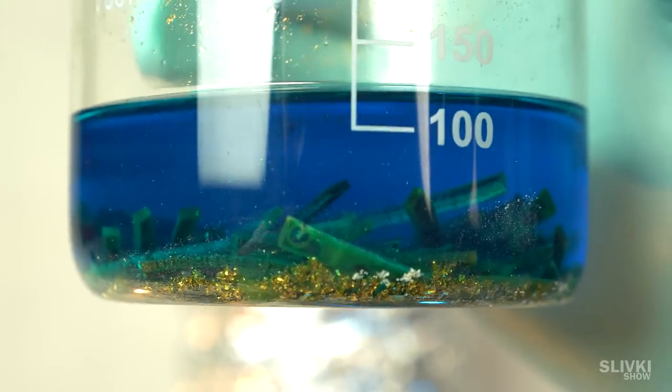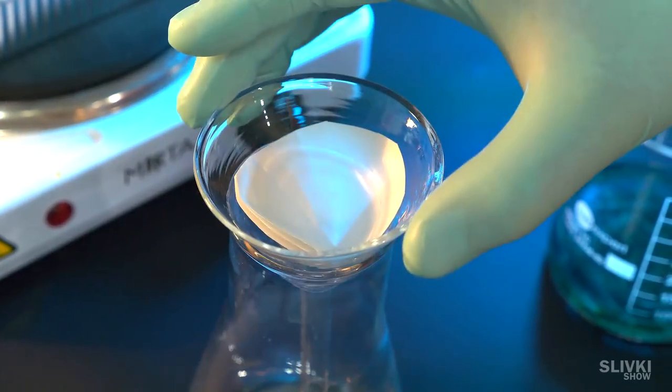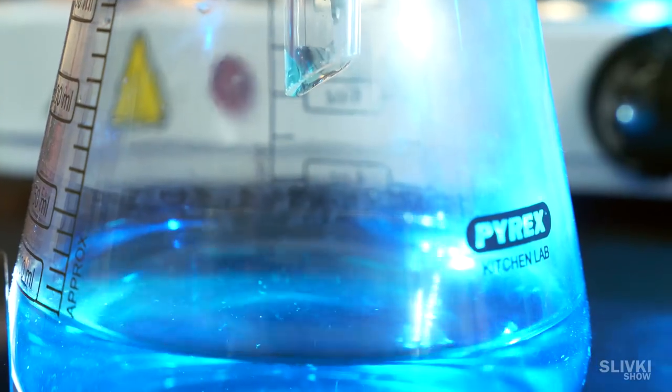So, our reaction is over. All gold got rid of from fingers and taking paper filter, we pull acid to other container.